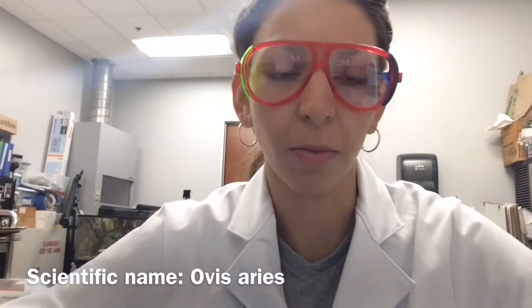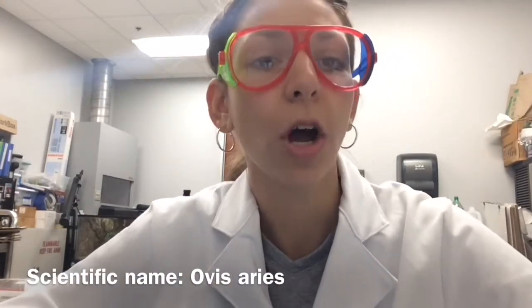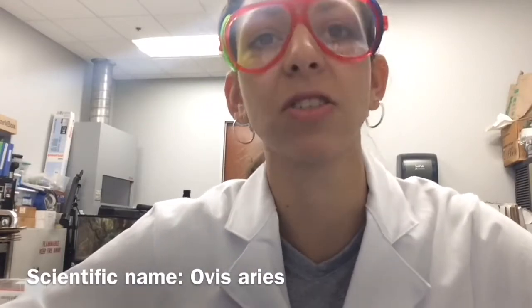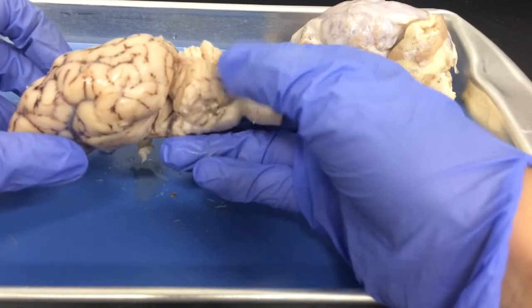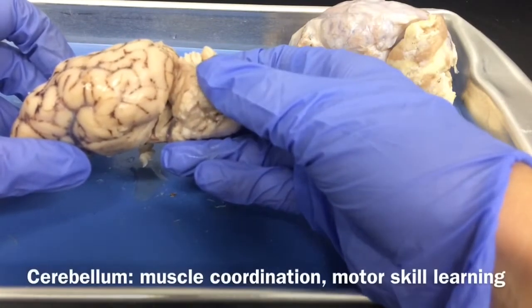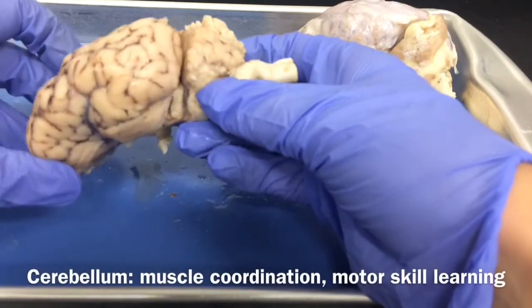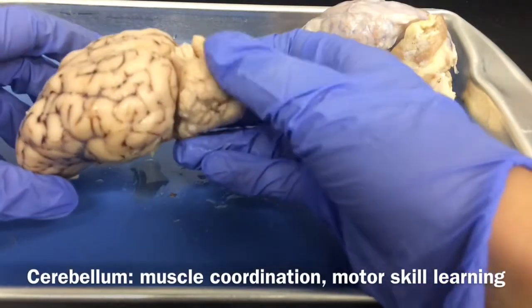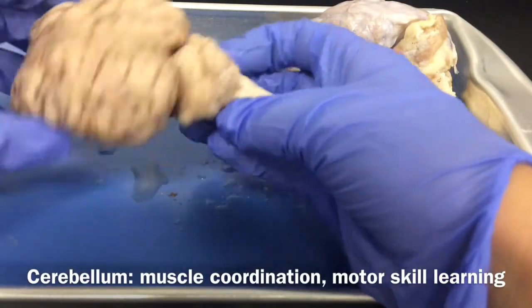So all mammalian brains have a lot of similarities, and so we're going to talk about some of the things that are similar with our sheep brain and our human brain, and some of the differences as well, before we dive into our dissection. First of all, the location of the cerebellum on the sheep brain is a little bit different from that of the human brain. Remember, the cerebellum controls muscle coordination, our sense of balance, and also our motor skill learning as well. It's more posterior on the sheep brain than it is on the human brain.